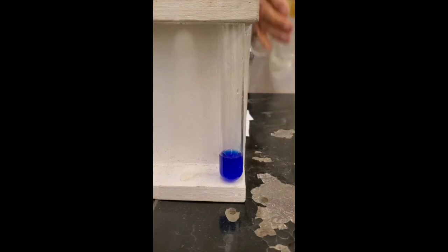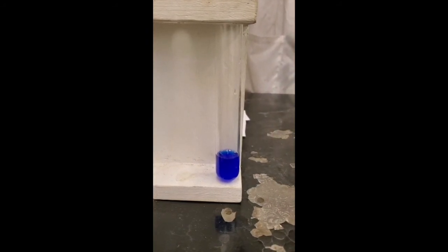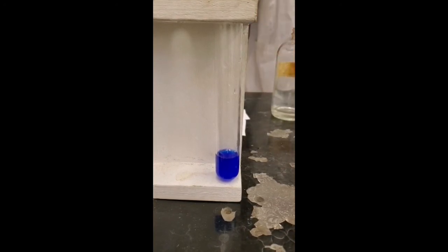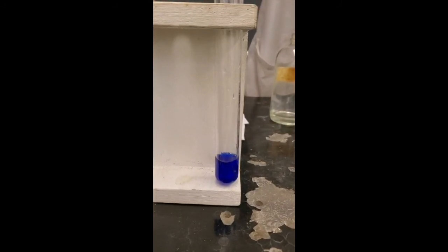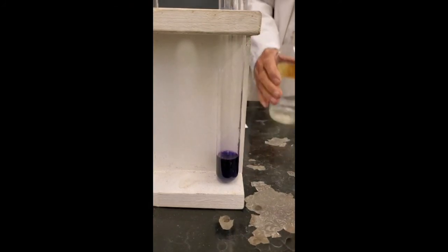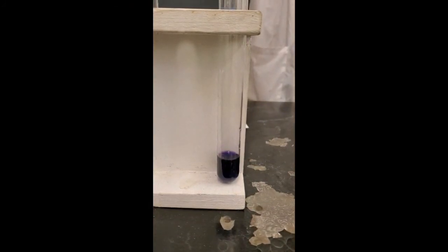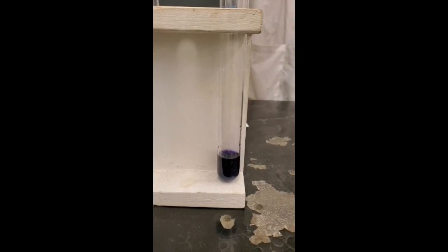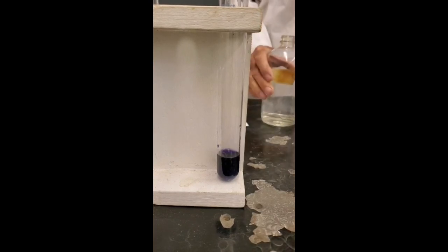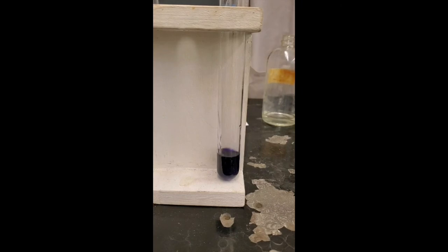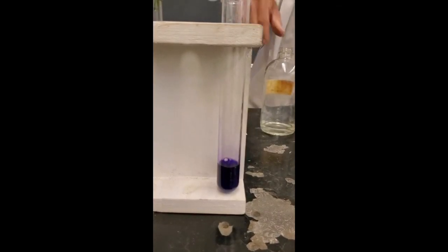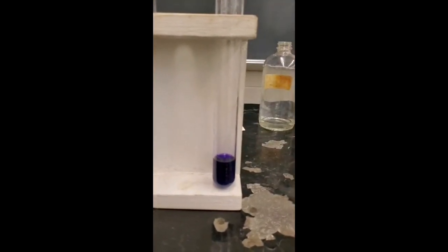Let me add another one. It gets to get a little bit of change. A little bit of change. Now I'm going to add another one. And there probably won't be any change except dilution. Because it turns out that the formation constant for the third one in copper is small compared to what it was in the case of the nickel. But that is a different color. It's a purple color, right? And that concludes it.